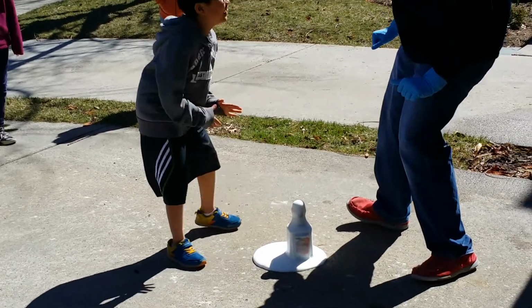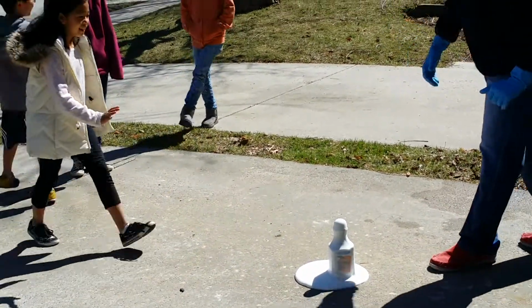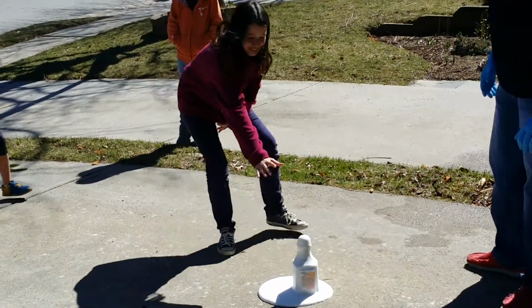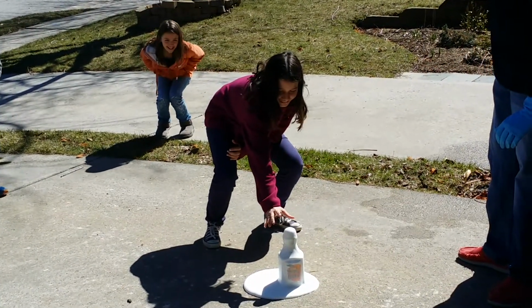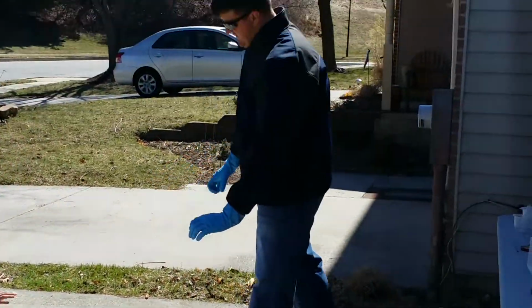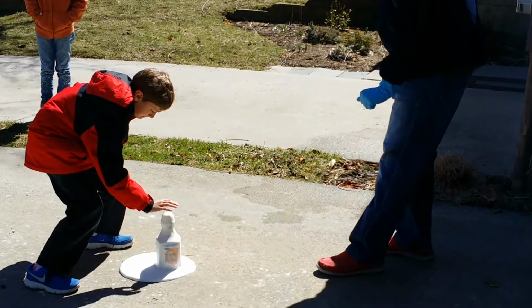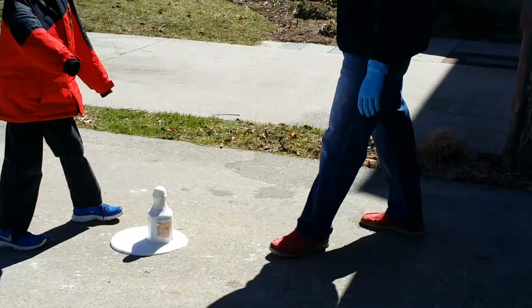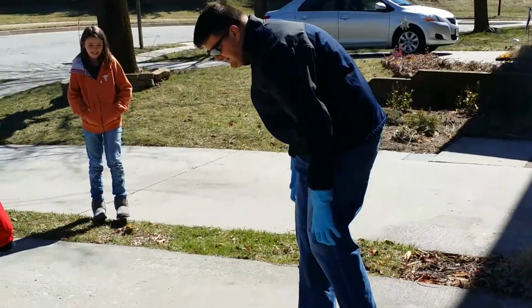Oh my god. I know. Right? Go ahead, Caitlin. Yep. It's hot. Good. Oh yeah. Oh wow. Yep, there you go. Don't touch the foam, but I mean our reaction's still going. So yep, just like that. You feel how it's a little bit warm? All right, Lo, move back. All right. Well, maybe it's coming out a little bit.